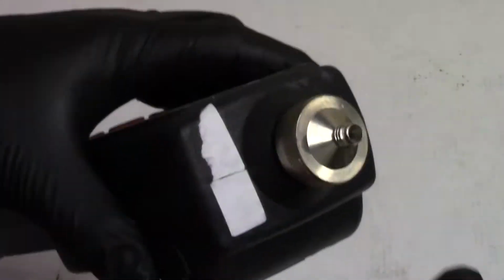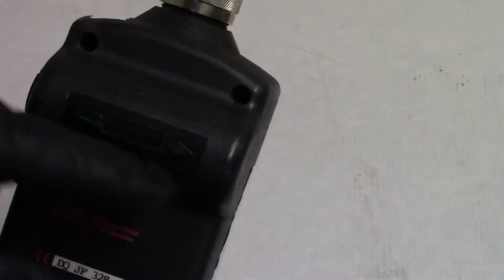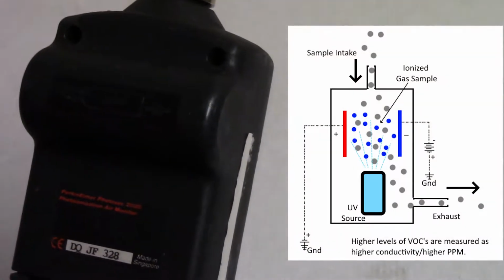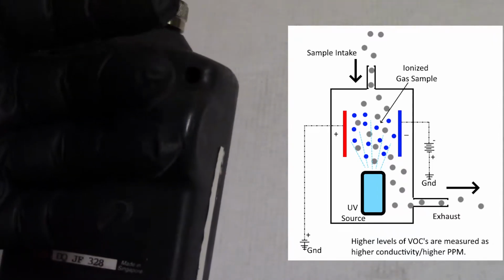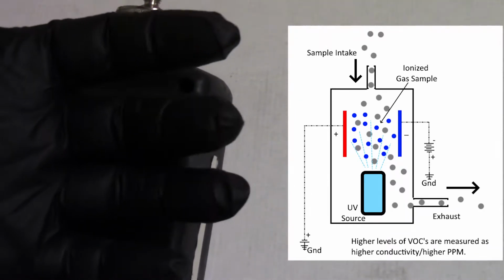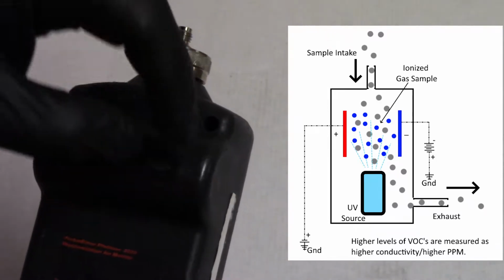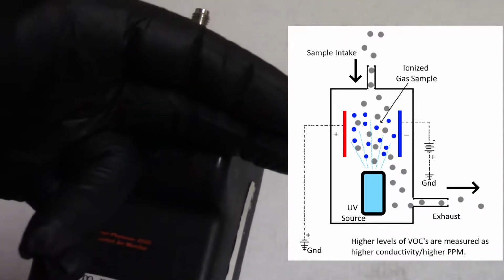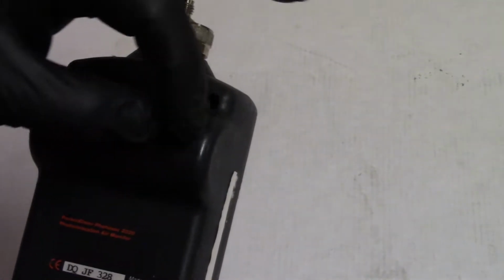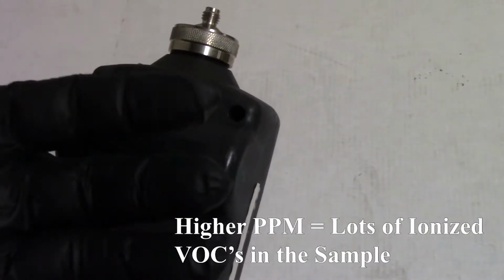After the sample is sucked inside with the air pump, it's passed through two metal plates which are inside this cavity here. Inside this cavity there's a UV light source. The UV light shines through the air path that the sample is going through, and that UV light causes the volatile compounds in there to become ionized. Once they become ionized, the two metal plates that they're across can conduct some electricity across those plates through the sample. This is going through air. The amount of conductivity through the sample across those two plates is what dictates how much of the sample gases are in there.